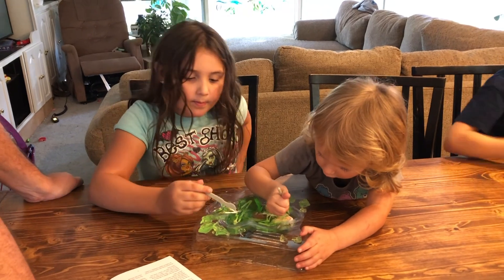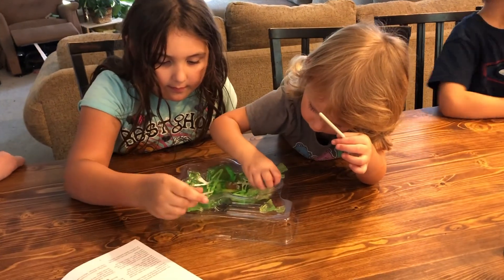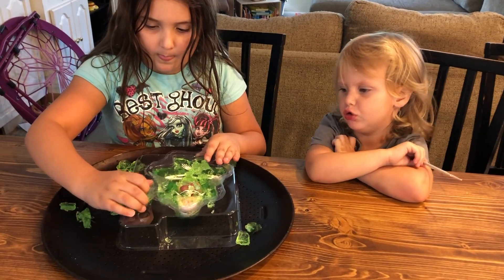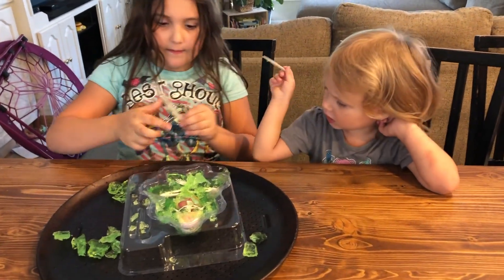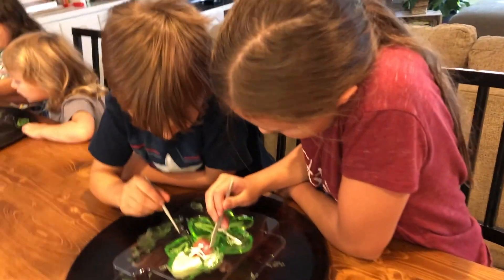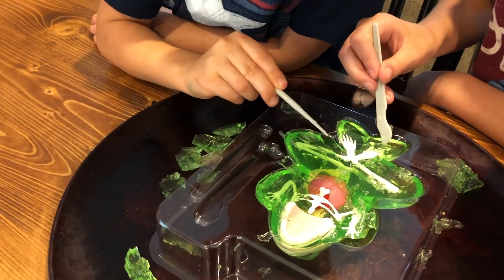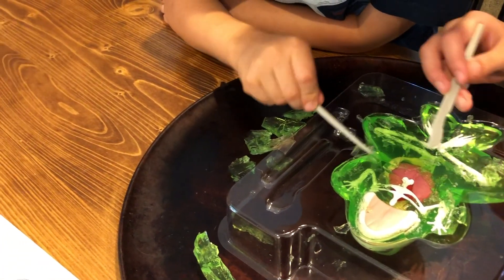What do you think is the femur on this one? Jemma's job is picking up. This is the heel. I'm trying to push off to finish looking at the skeletal structure and then we're going to find the organs. It's hand is coming in probably first. I'm doing really good at chopping off the skin. Oh, there goes their rib cage.